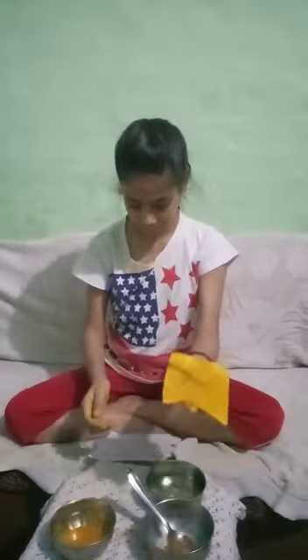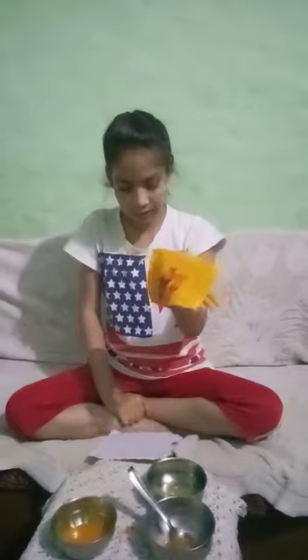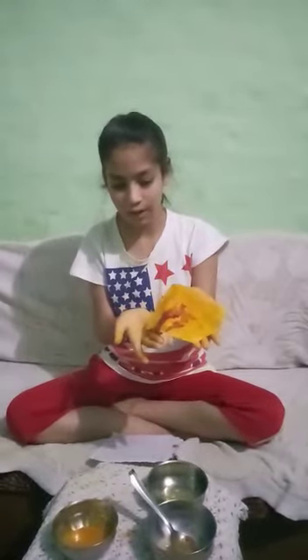Here, put soap water on this paper. There is absolutely a change in color, which becomes yellow to red. That means the soap is basic and lemon is acid. Thank you and have a nice day.